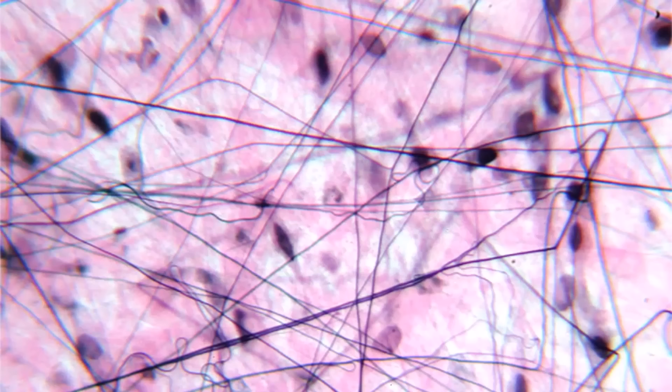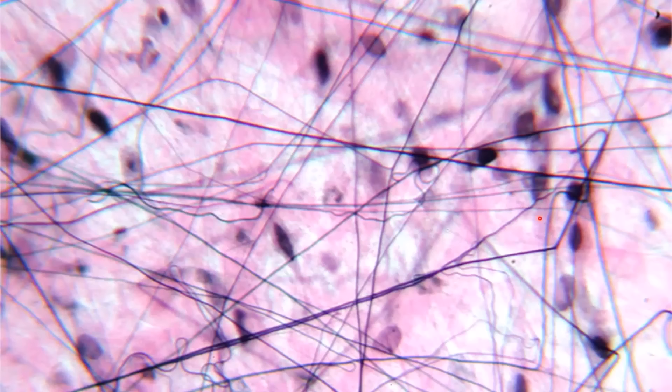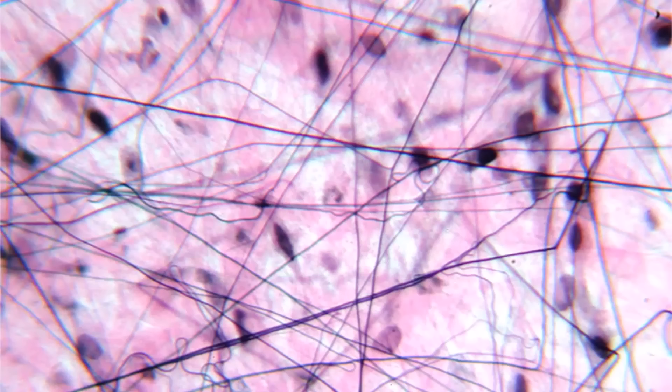You have these black fibers going in all different directions in the foreground, and there's kind of a haze of pink in the back. That haze of pink is collagen fibers which are out of focus. And you're seeing many of these little black circles, which are fibroblasts. All of those things should tell you that this is areolar connective tissue.